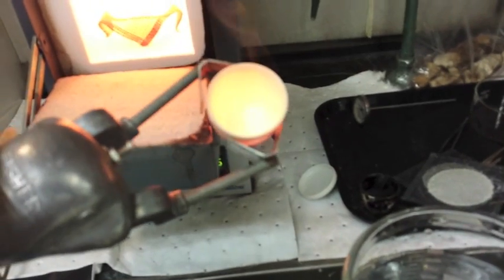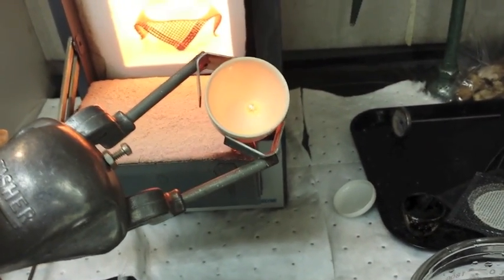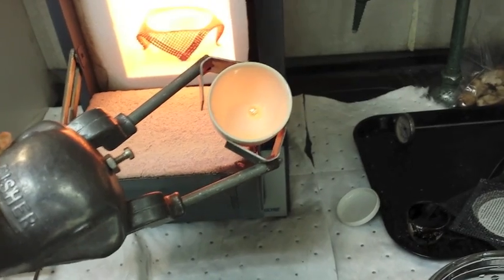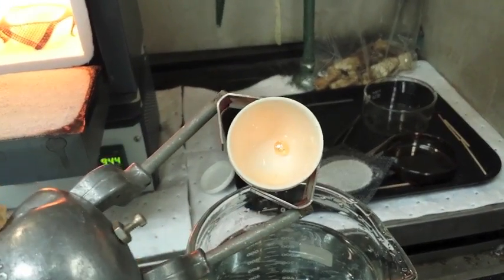It is solidified in there. See it? There we go. There's our hunk of gold. So I'm going to let it get back up, and then dump it out. But as you can see, there is our gold.